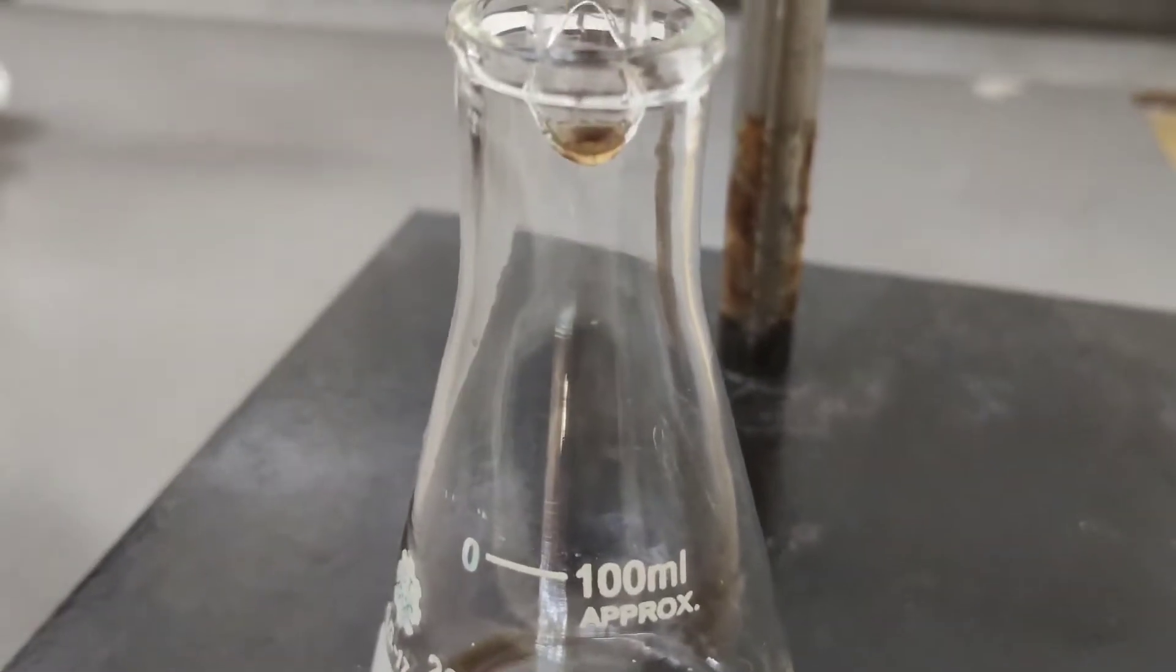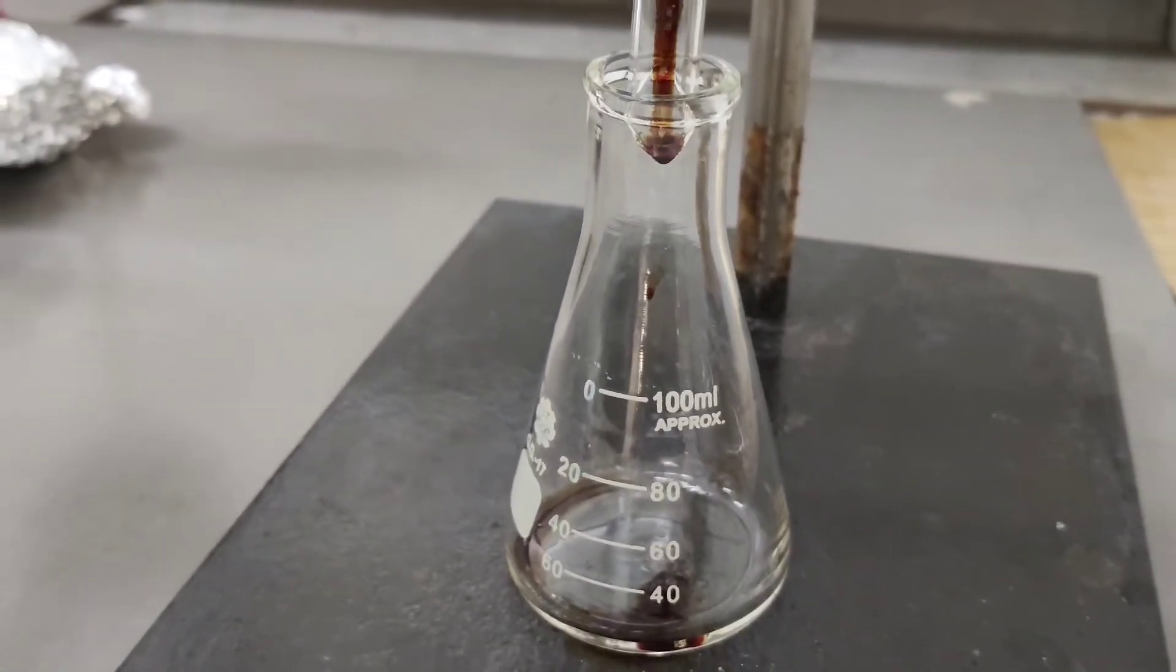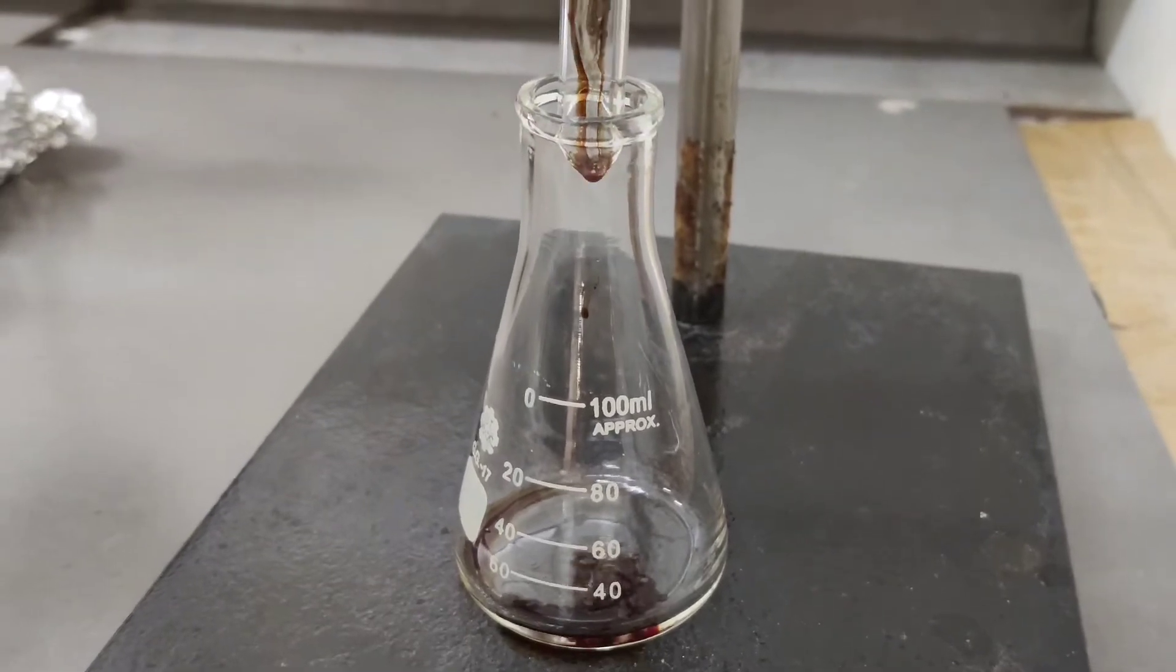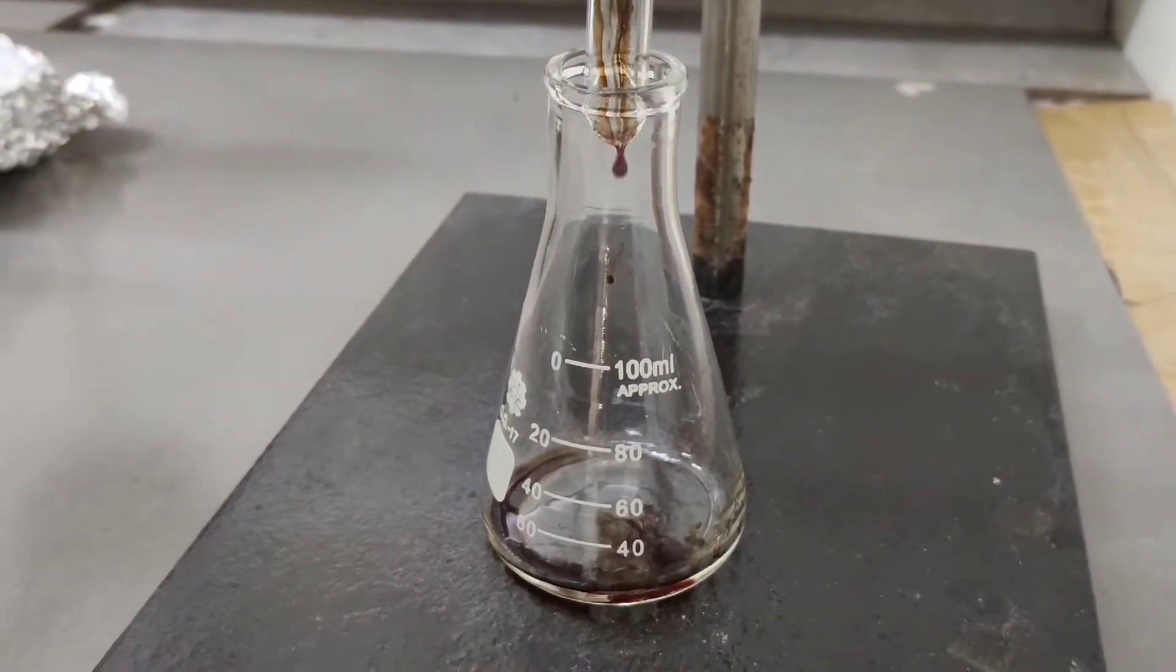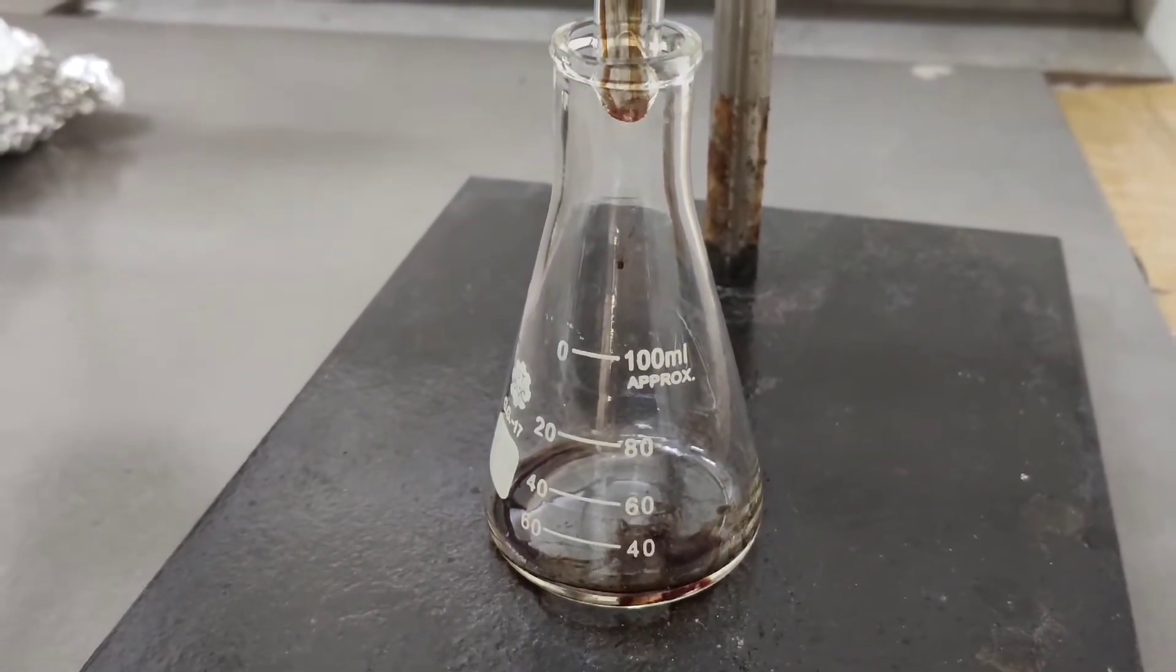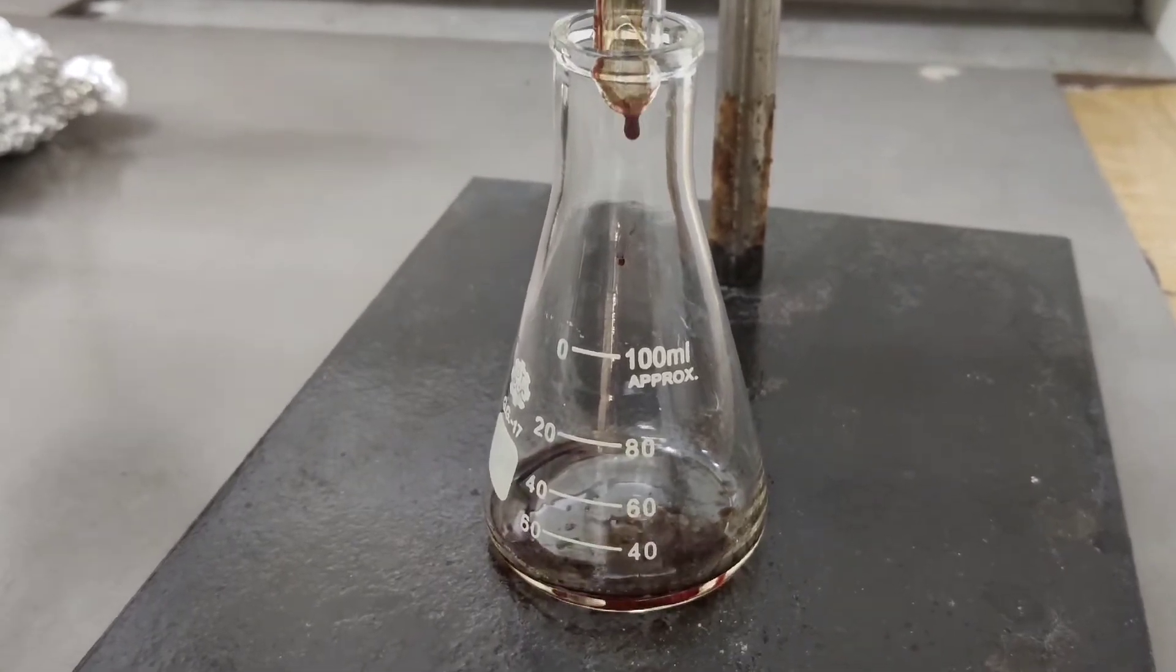When we do this we can see the solution coming down to the Erlenmeyer flask and we see some water together with the DCM that we are going to have to dry later.